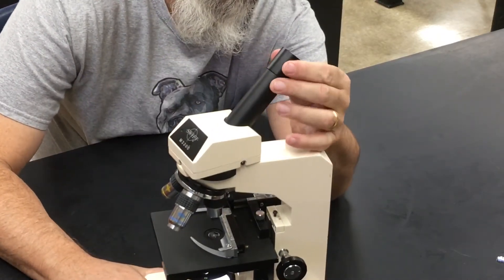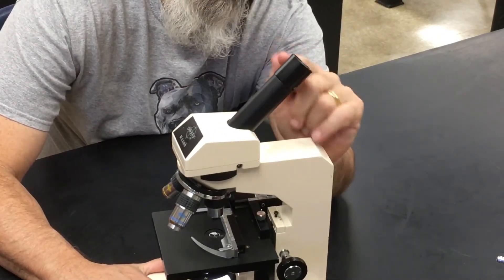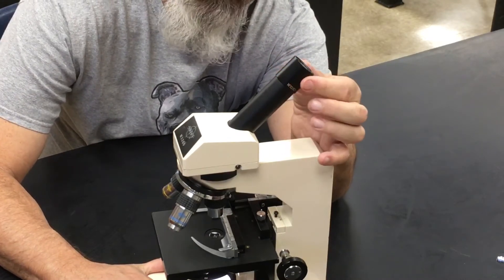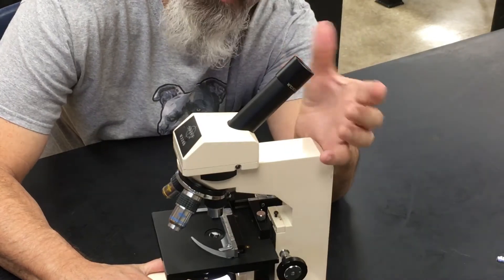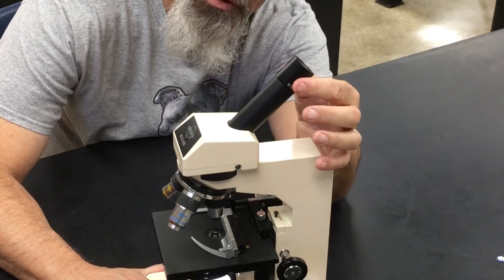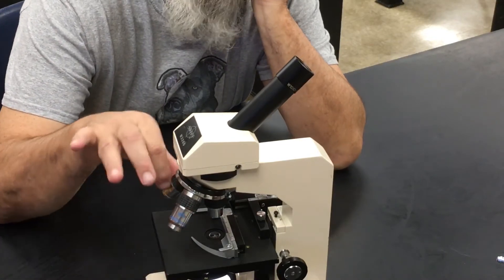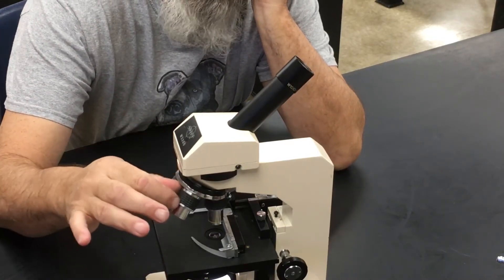This right here is called the ocular lens. It has a magnification of 10 — it's also called the eyepiece, but 'ocular lens' may be the term used on your final. The other lenses are called the objective lenses; we've got low power, medium, and high power.